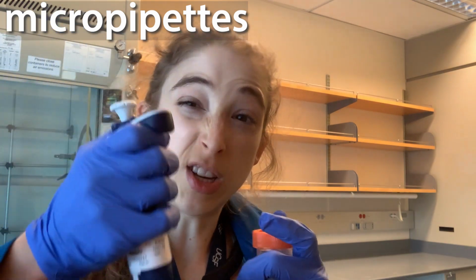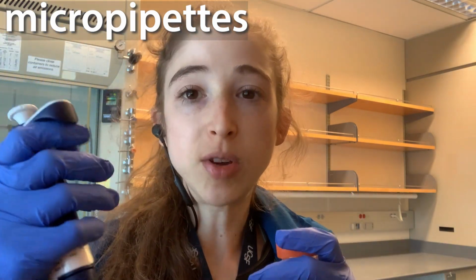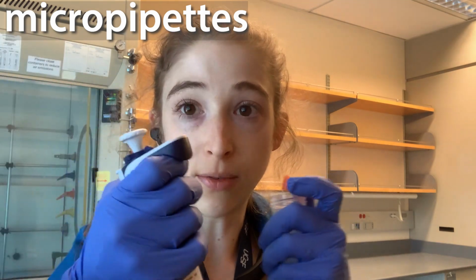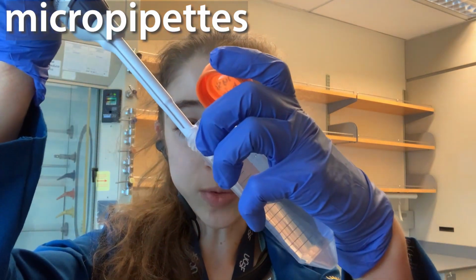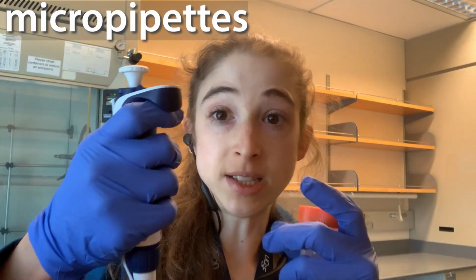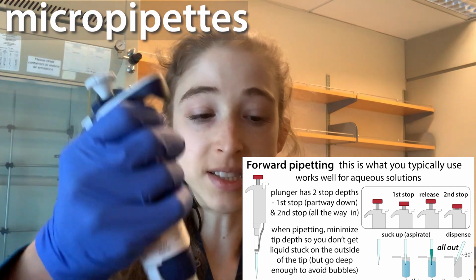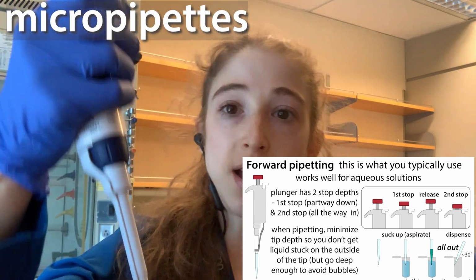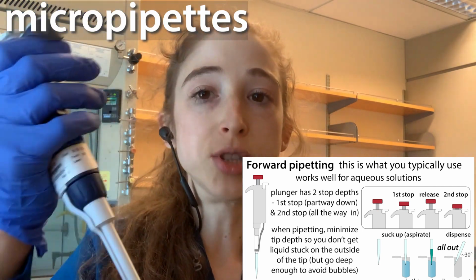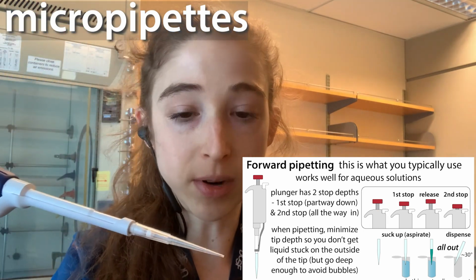When I talk about going slow when you're pipetting, this is especially important if it's viscous. You kind of get a feel for the flow of the liquid. So watch it when it's coming up. If it's coming slower than your thumb, you need to slow your thumb down. If something's really viscous, even though your thumb might be all the way up, it's still drawing up. So you want to watch it and go with the flow of the liquid coming up into the pipette.